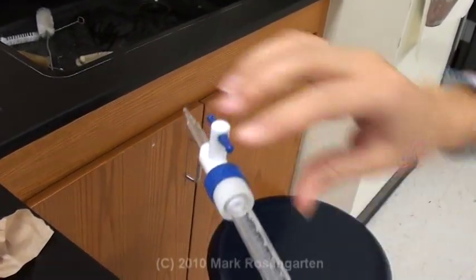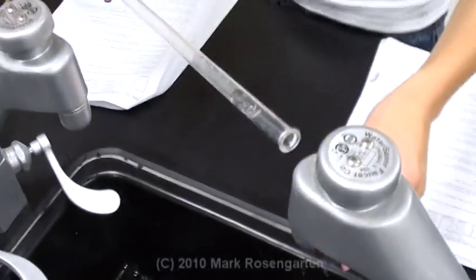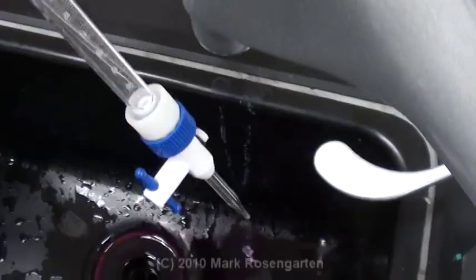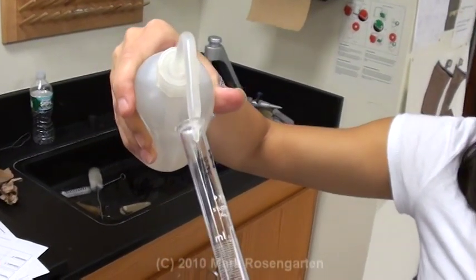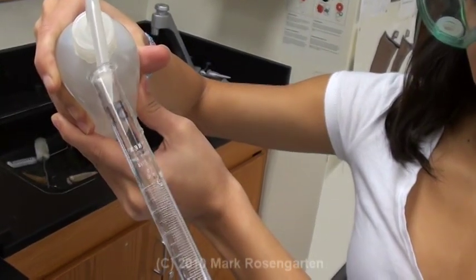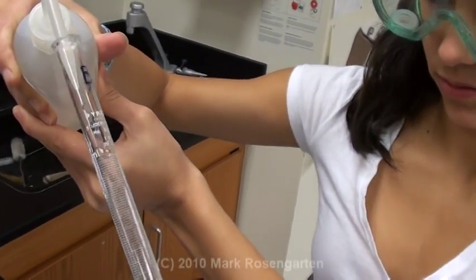Then close the valve, turn it right side up, open the vent once more, and add distilled water to the top as you rotate the burette to clean out all sides.